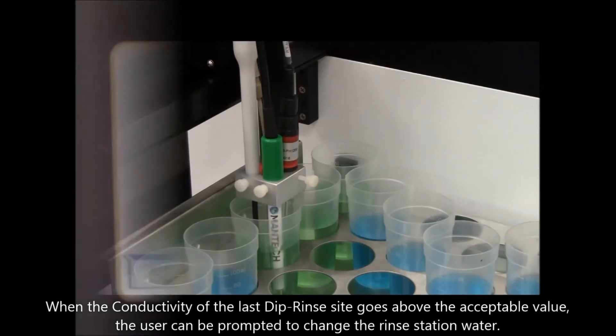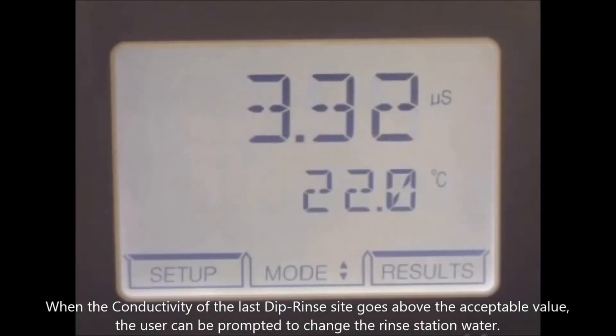When the conductivity of the last dip rinse site goes above the acceptable value, the user can be prompted to change the rinse station water.